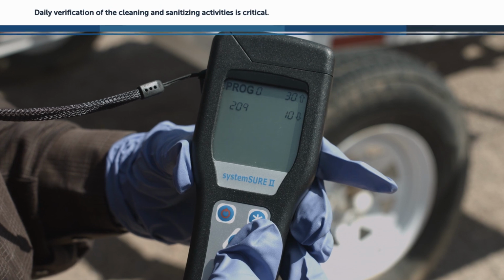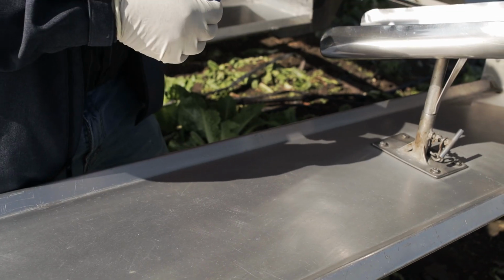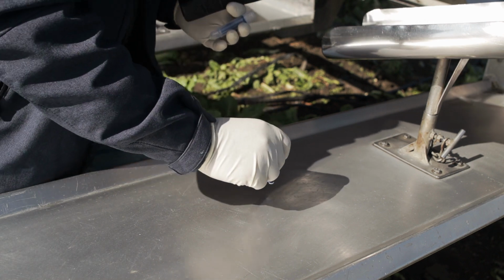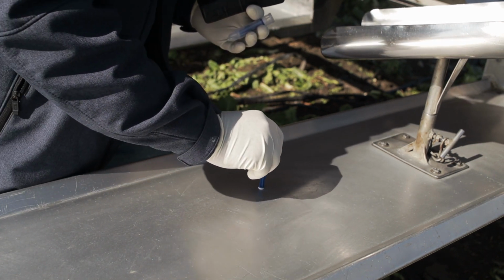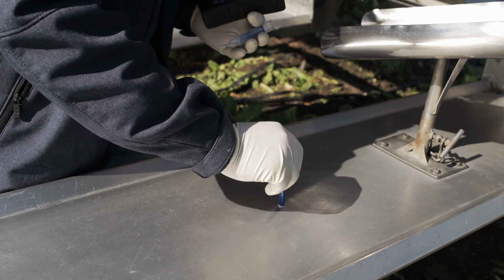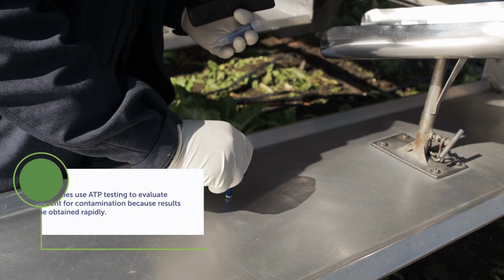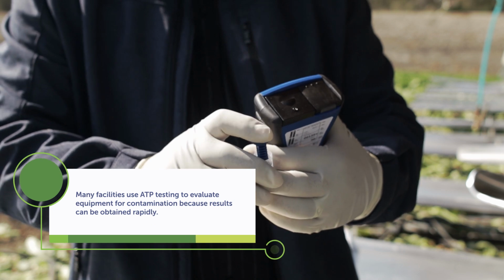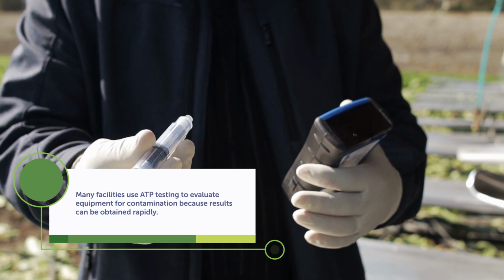Daily verification of the cleaning and sanitizing activities is critical. The food safety professional or assigned employees usually perform visual inspections and microbial tests to evaluate that equipment has been properly cleaned and sanitized. Additionally, many facilities use ATP testing to evaluate equipment for contamination because results can be obtained rapidly.